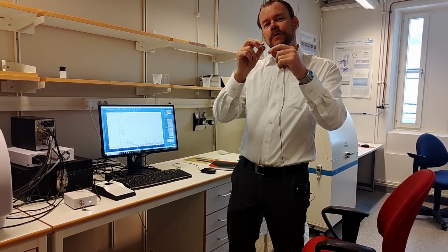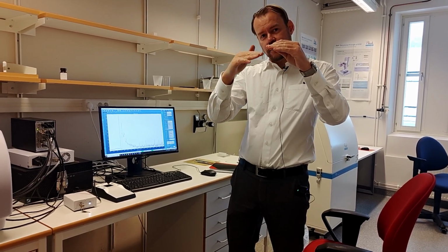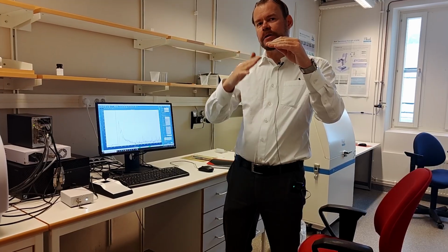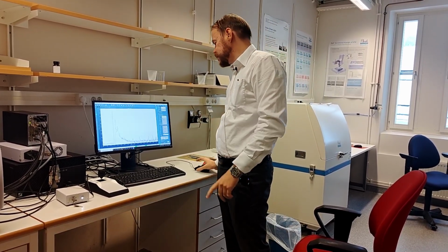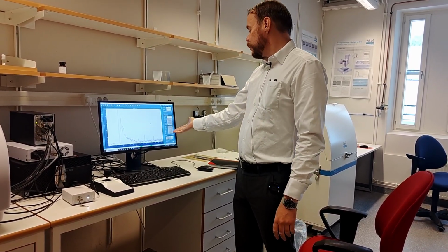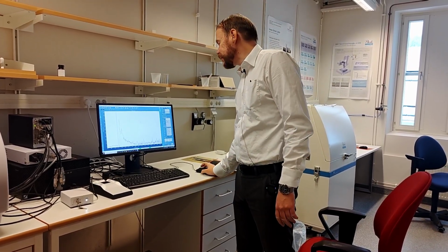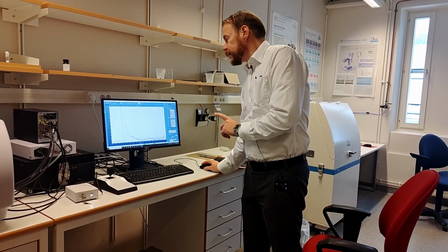So the only reason you want to have it from the focusing point is if you have material you want to study by depth, where the concentration is changing or something like that. Then you want it to be on 100. So this is an important decision to make. You can just leave it on 100 for now. Since this is just a medical powder, putting it on 500 will actually be more advisable here. That's it, we just leave everything there. Click scan.